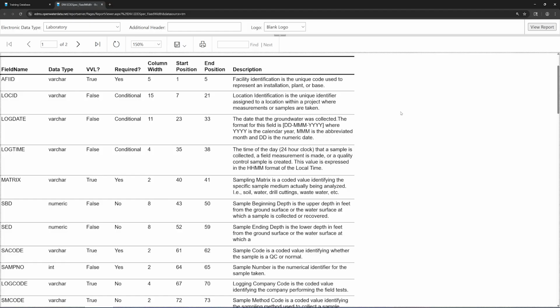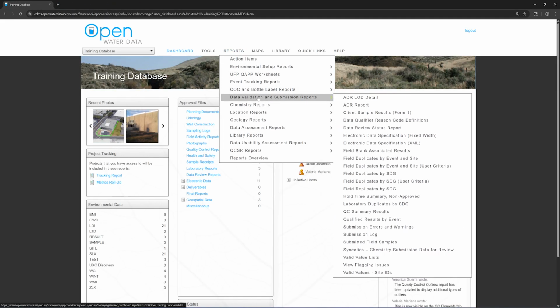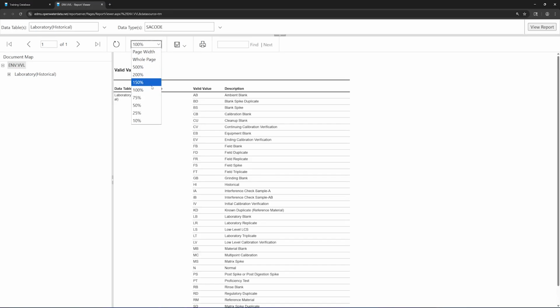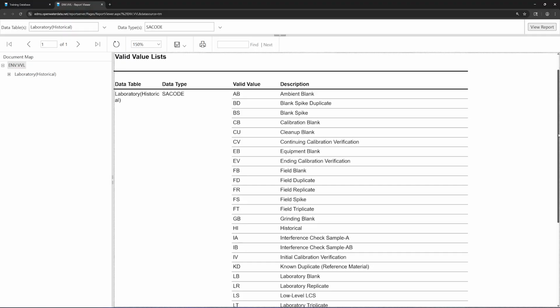Valid values can be found under Reports, Data Validation and Submission Reports, Valid Value Lists. For example, choose Laboratory for the data table and SA code for the data type. Click View Report. We could make sure to choose the best option from this list and populate our file. You can save this report in a variety of formats by clicking on the floppy disk icon.